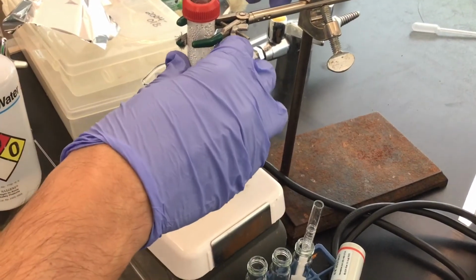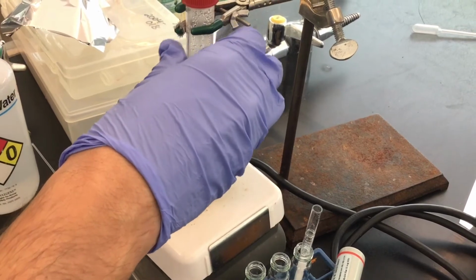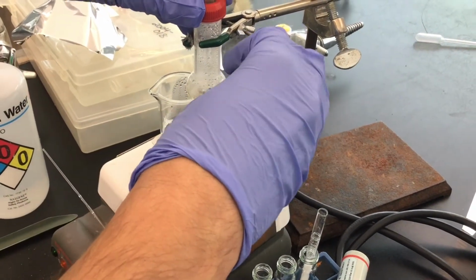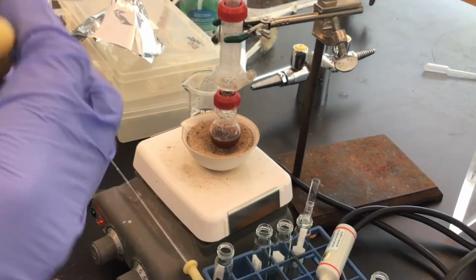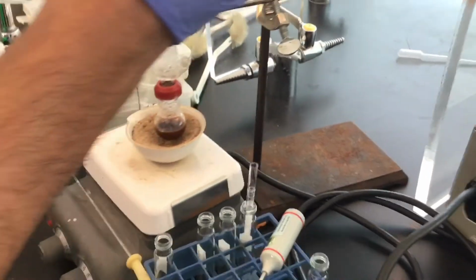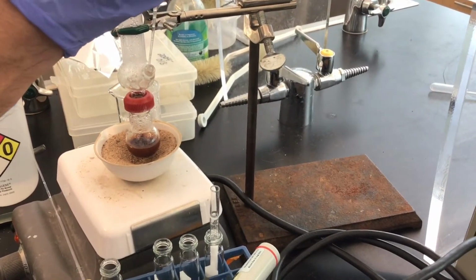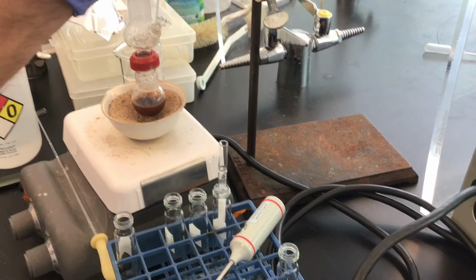So what I've decided to do now is that every time I take distillate out, I'm also going to raise the whole thing to avoid that, because I really do not want any bark or brown material to collect in my still head.